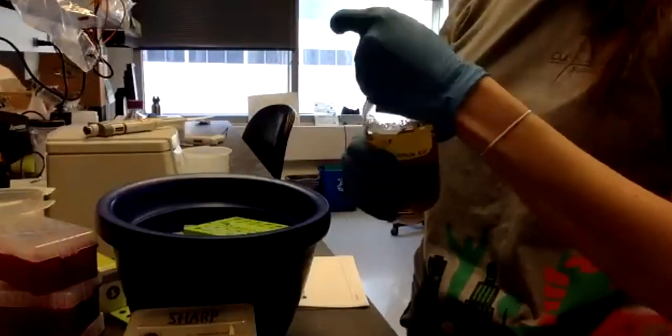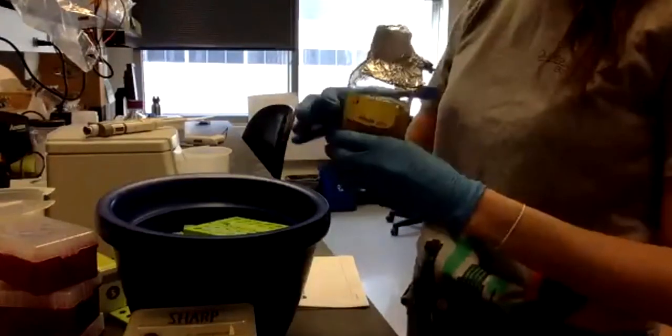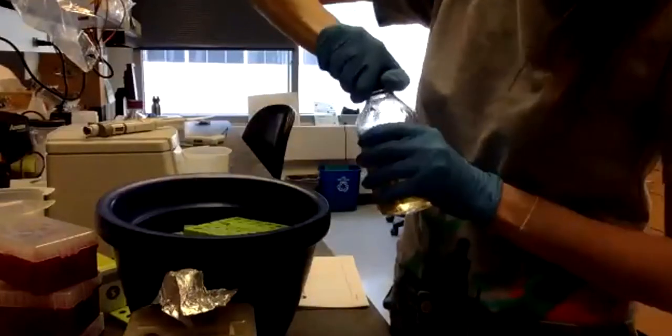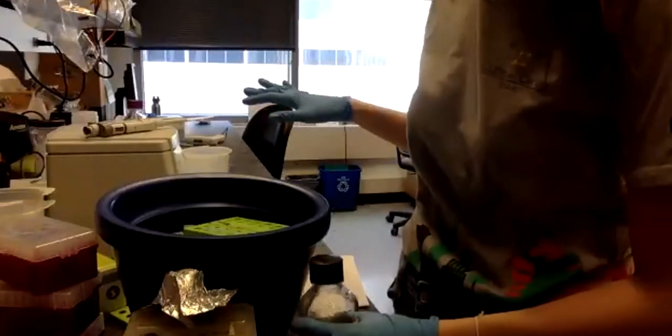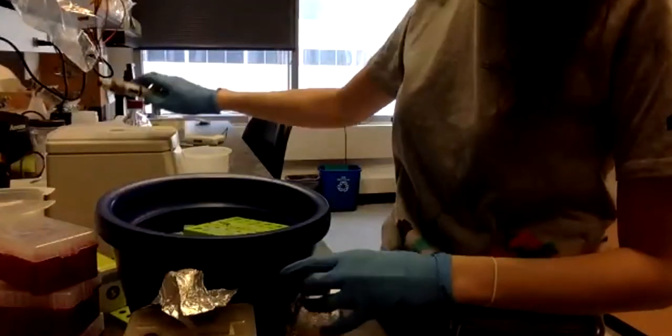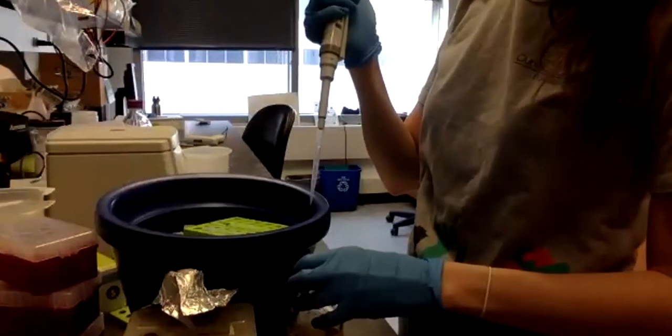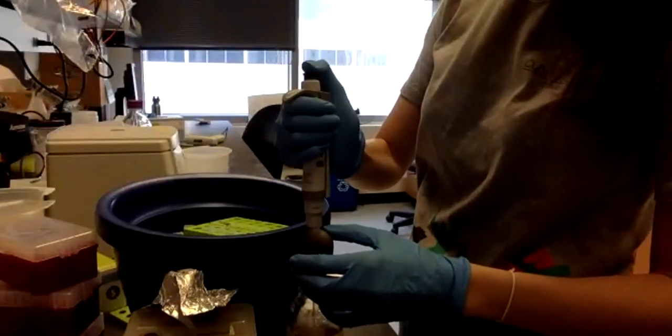Why do you think this is important? Who can tell me why we autoclaved it? Do you know what an autoclave is? No? I will show you what it is.